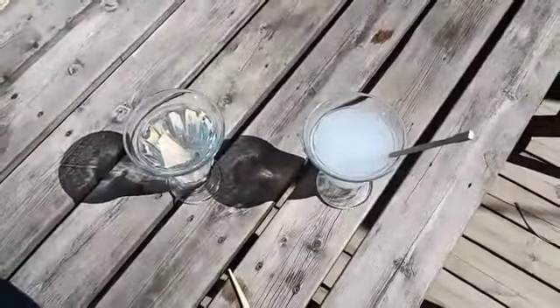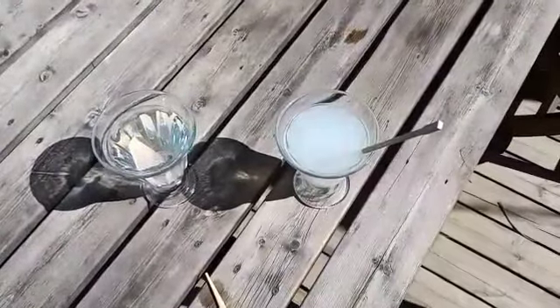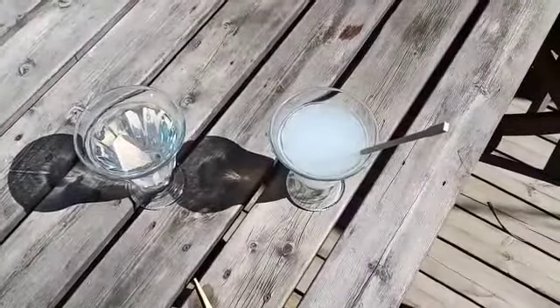So in this case, we can say Dural is slightly better. Thank you for your attention. This is Markus Finnilä with 15 years of experience of water soluble hot melts. Thank you very much.